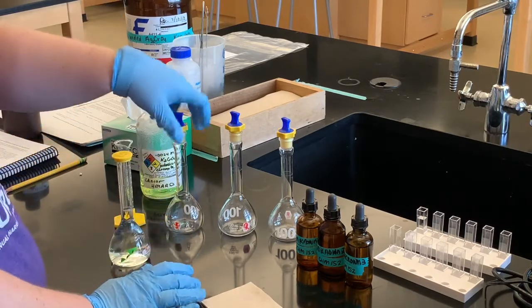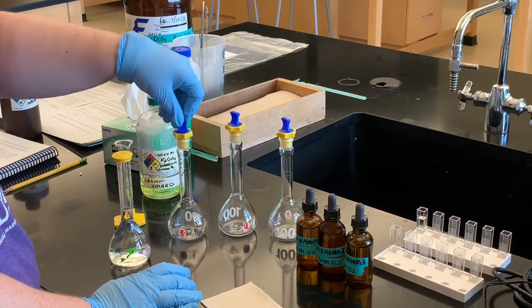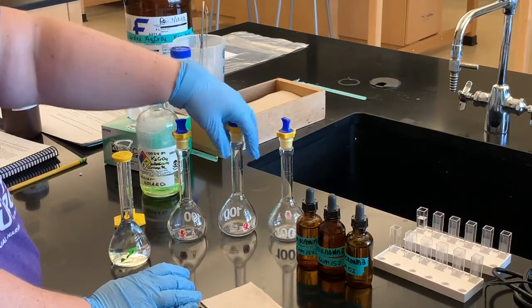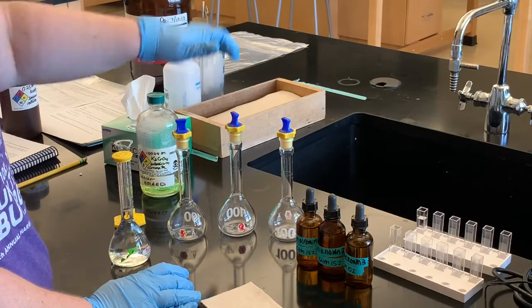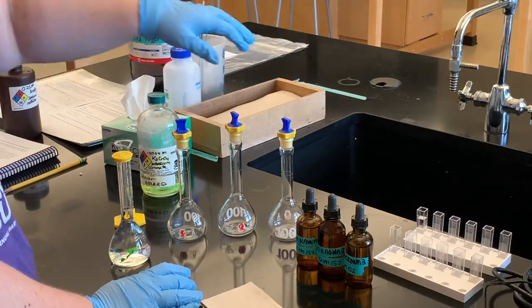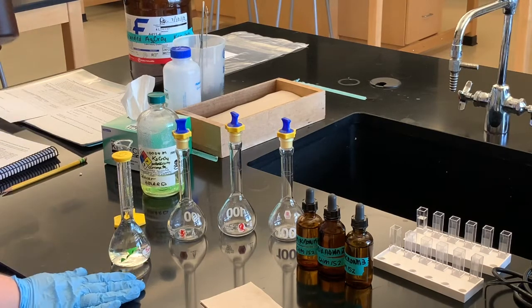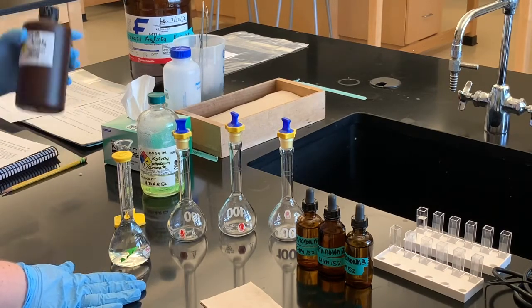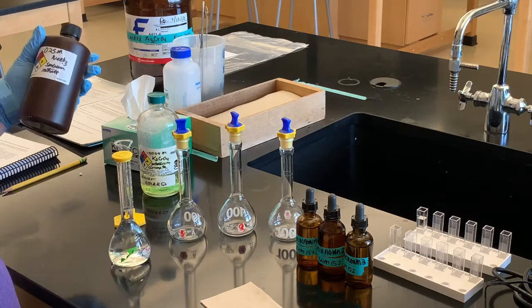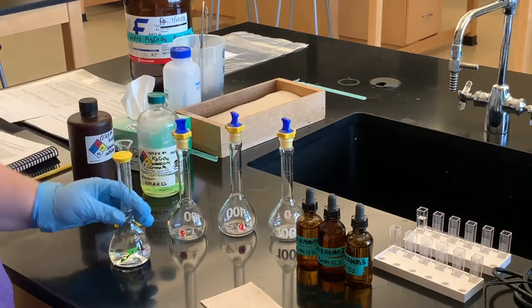We have volumetric flasks for five milliliters of our potassium chromate, ten milliliters, and then fifteen milliliters of potassium chromate. Each of those will be diluted with the 0.25 molar sodium nitrate — it's the same process.